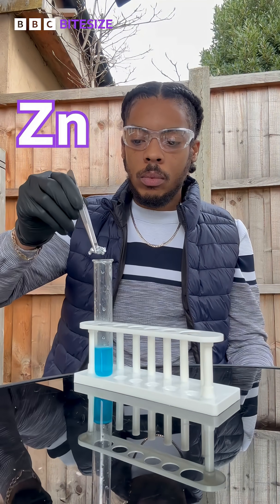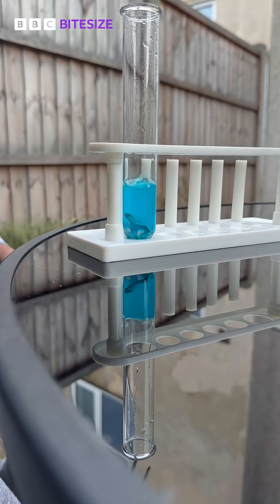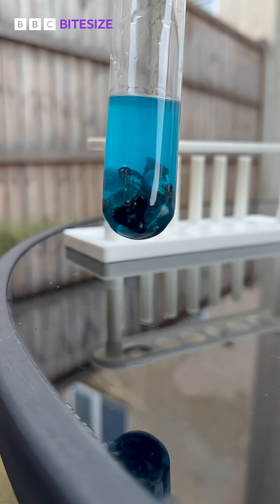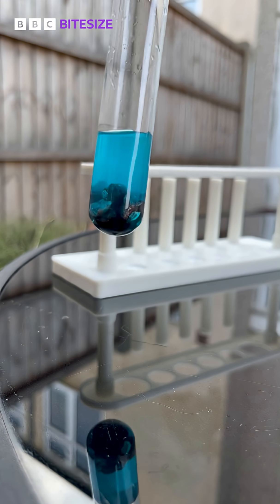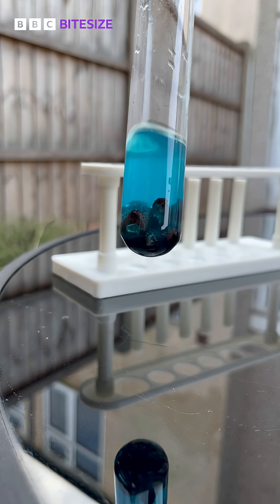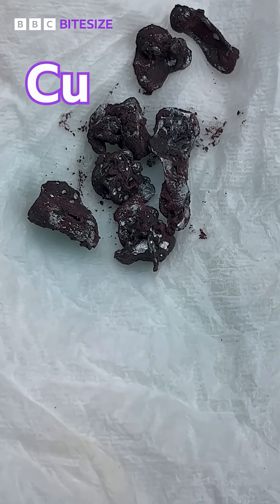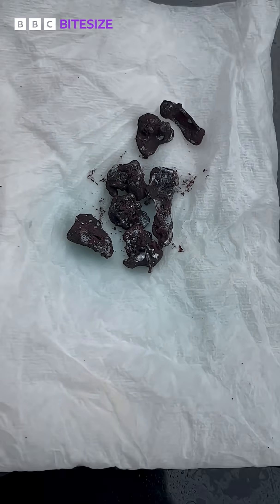Now let's add some zinc to copper sulfate and see what happens. Zinc is more reactive than copper, so the zinc is able to displace the copper in copper sulfate and form zinc sulfate. As that's being formed, the solution is getting paler in colour. We can also see the displaced copper precipitate on the zinc metal.